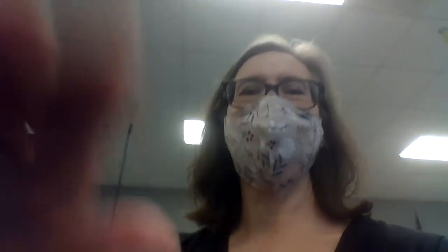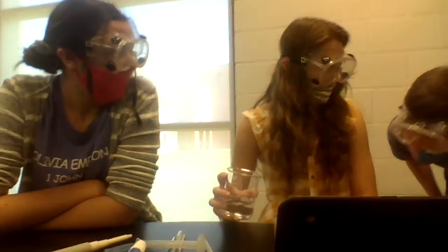You're going to have to do... They're trying to show us how inaccurate. Yes, you are exactly right. Try for 1 milliliter. So adjust that so that you can kind of see what you're doing.